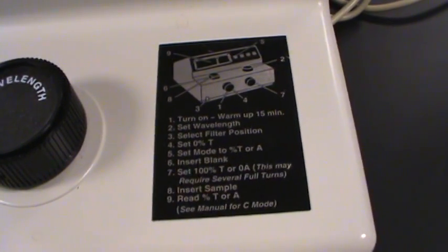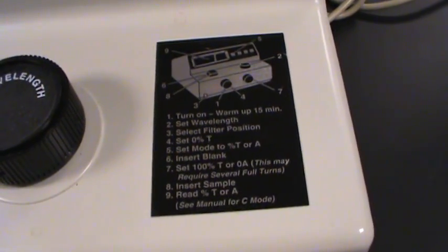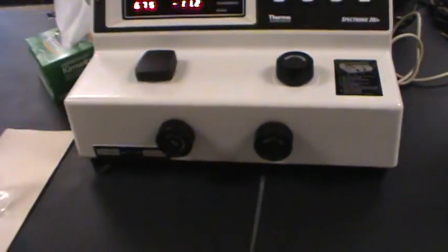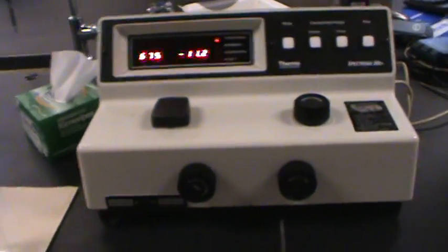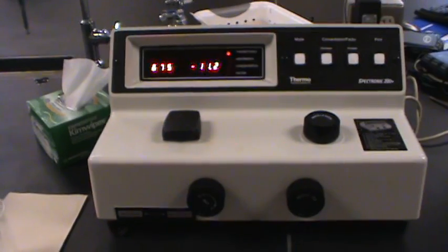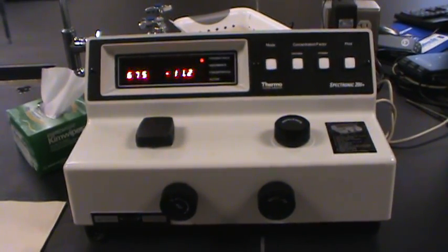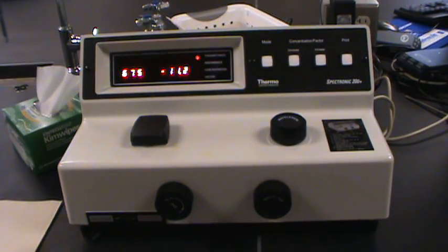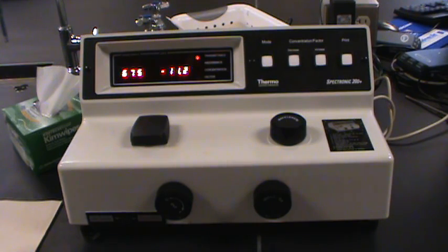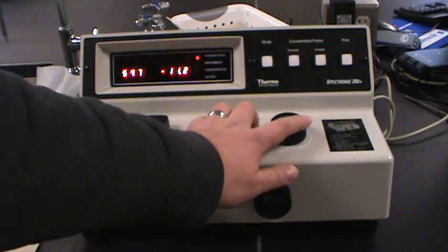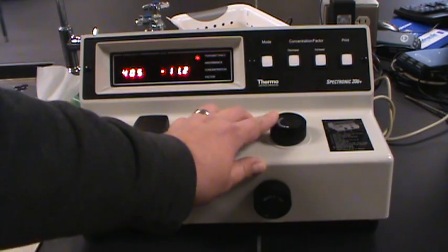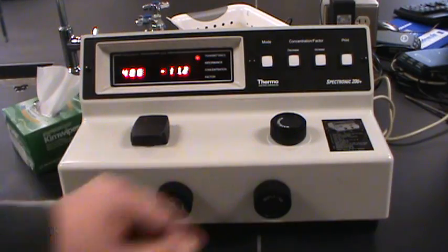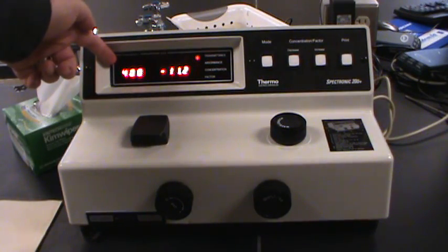Well once you know how to use it, it really is going to be that quick and that simple. But let's take a look at a calibration. So I've got my instrument turned on. It's warmed up maybe not quite for 15 minutes but we can make do. I've got my filter switch in the position I want. So first thing I need to do is decide what wavelength to start at. I'm going to start down at 400. So I can turn the wavelength dial until I get a wavelength reading of 400.